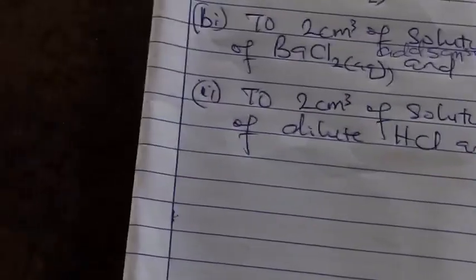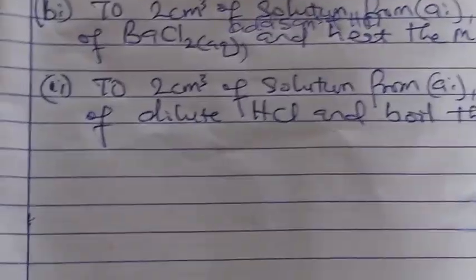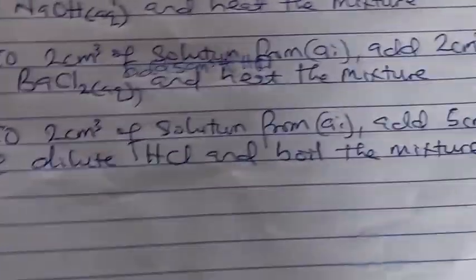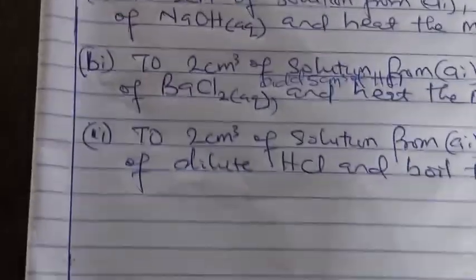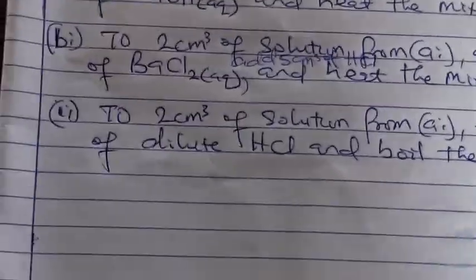So in this examination, they cannot ask you BI and BII at the same time. So it can come in the form of what? BI, you add barium chloride and then HCl and heat. Or you are asked to add only what? Add HCl and heat without adding barium chloride. So BII is an alternative for BI. Do you understand? So let's go to the board and report the work.